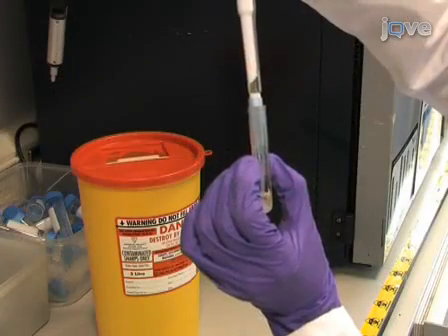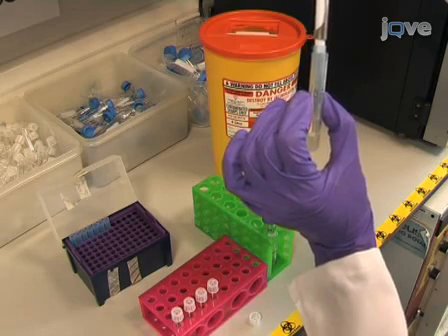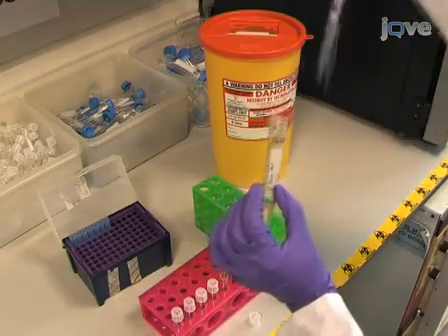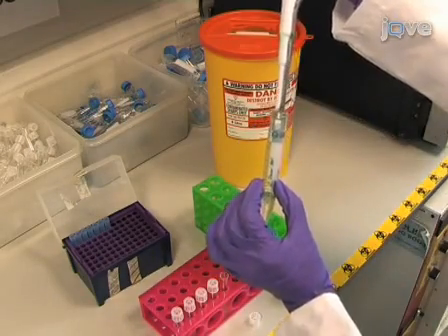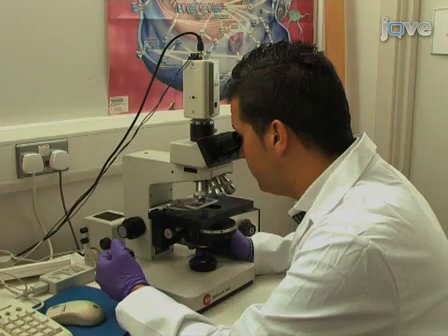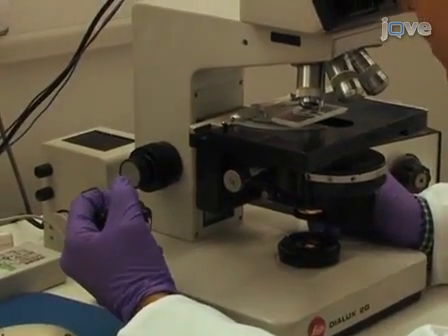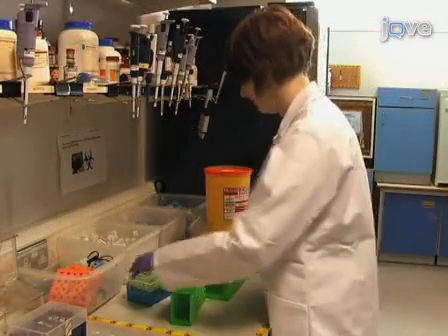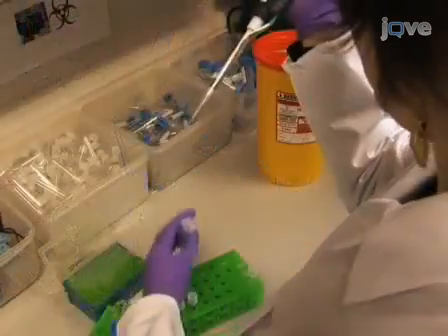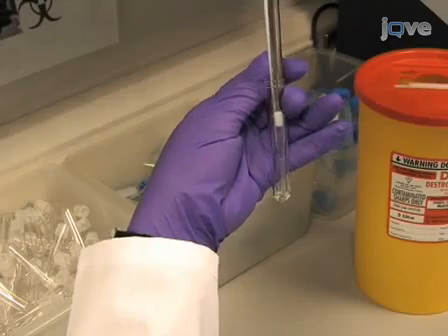Gently pipette off the top 0.7 ml of solution and pour the solution from all tubes into a clean 15 ml polystyrene centrifuge tube. Shake gently to mix. Count cells that have been immobilized with formalin in a Neubauer counting chamber. Bring the concentration to 6 million cells per milliliter in SEBSS and divide the sperm into 200 microliter aliquots in 5 ml polystyrene round bottom tubes. Cap loosely.